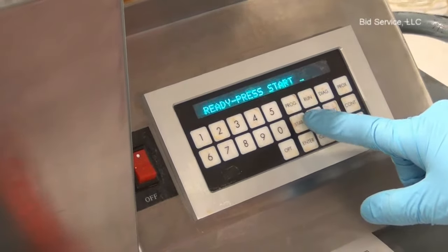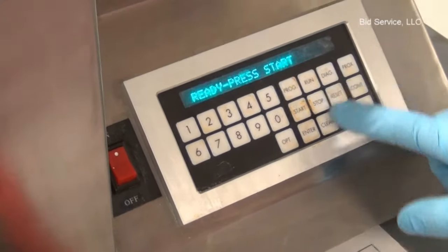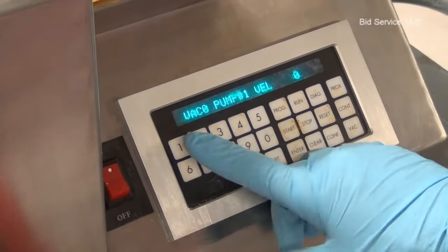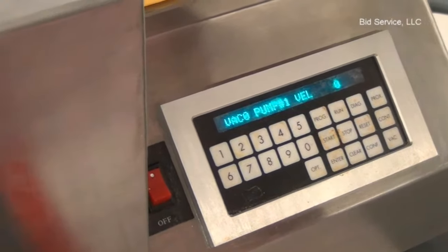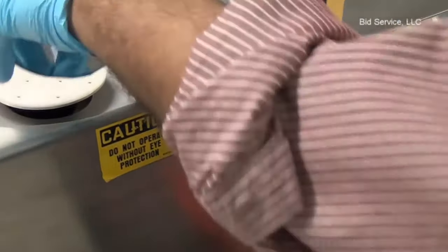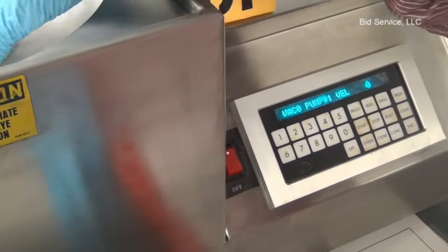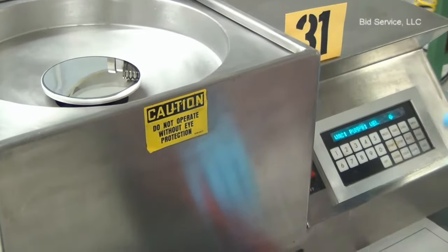At any point of time, if you want to stop the process, press the stop button. The second diagnostic is for displaying the system parameters and to check if the vacuum is present or not. If there is a wafer on the chuck, press 1 — it will display 1 on the display if there is a wafer on the chuck.